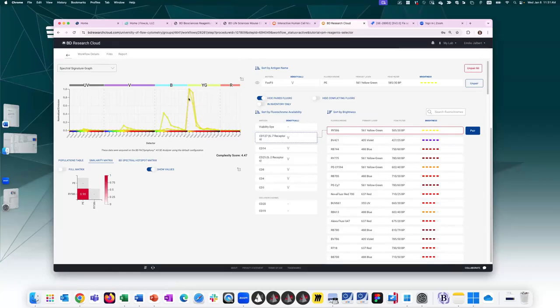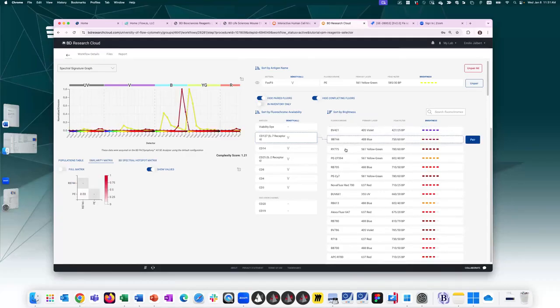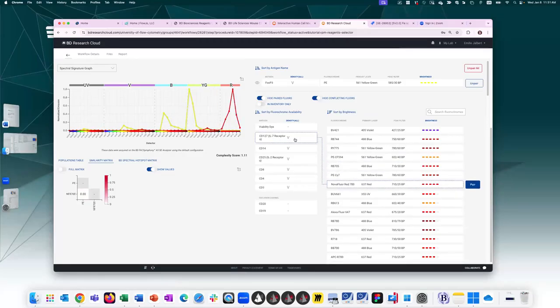I may or may not want to use these two together in the same panel. If I don't want to see any fluorochromes that have these warnings, I can say hide any conflicting fluors, and now it removes it from the list. And what I'm left with is fluorochromes that have lower similarity values. So I can continue and click on the different fluorochromes and determine which one I want to assign to my marker over here. Ideally, you're trying to spread out your fluorochromes across laser lines and also keeping in mind your antigen density. If I click on the hotspot matrix here, I can see those values populating.